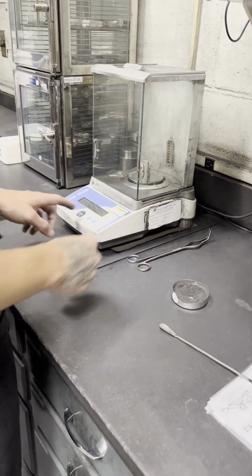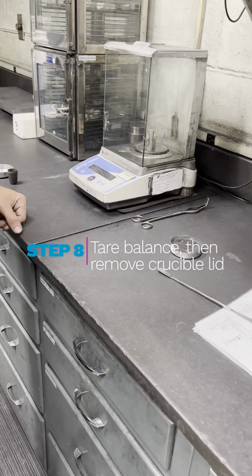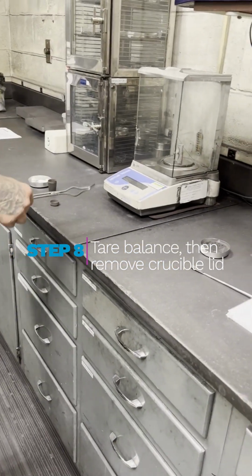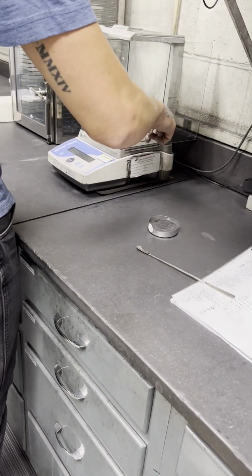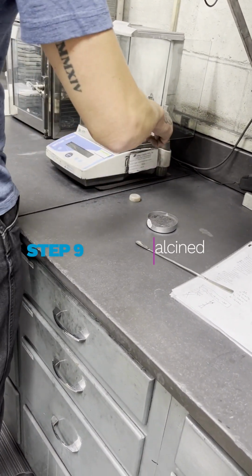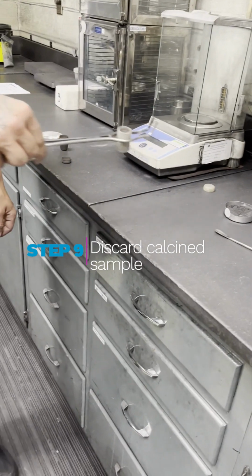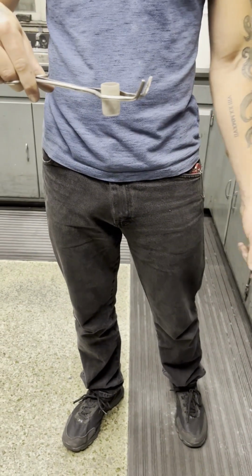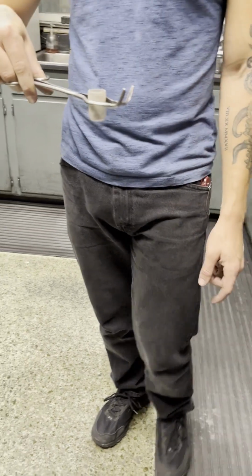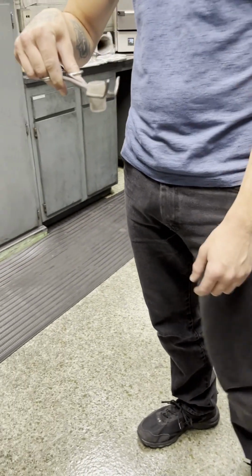So put the volatile in there. You're going to want to tare it out again until it's at 0. After we tare out the balance, we're going to remove the crucible lid. And now we're going to throw out all of the material inside the crucible. You can throw this out just in the trash. If you want to save it for later, you can, but there's nothing you can really use with it. This would be considered calcined material.